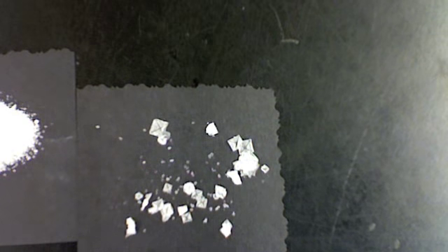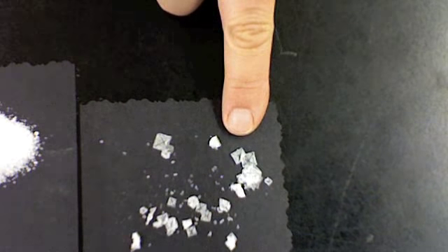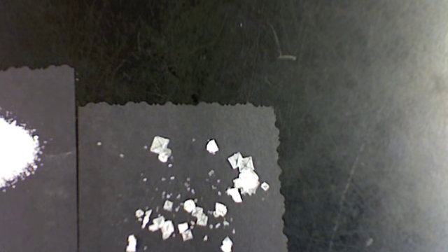and really look closely at, because a crystal has a particular shape and a pattern. If you were going to look at one of these big, lovely sodium chloride crystals, you would want to notice some properties of it.